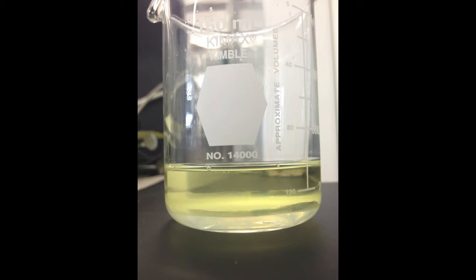After a minute of swirling, let it settle for a few minutes in order for two layers to develop. Tip the flask at a 45 degree angle and collect and discard the bottom layer.